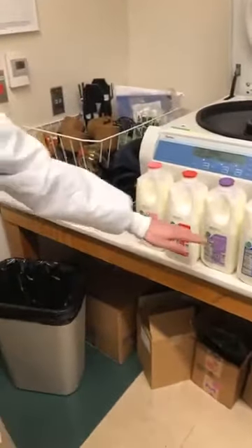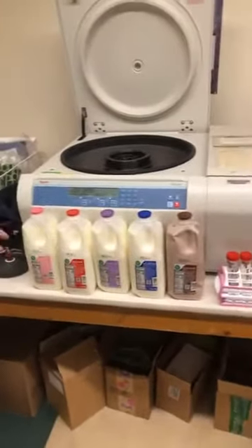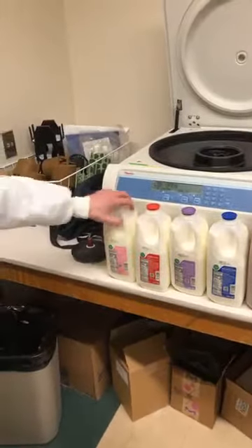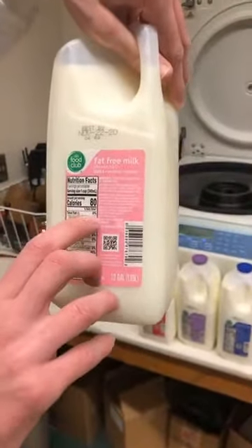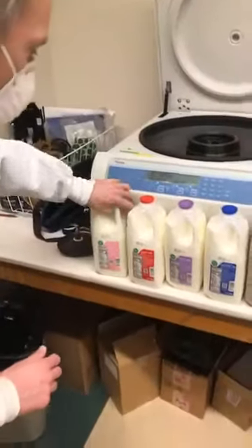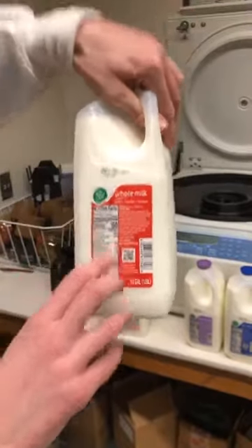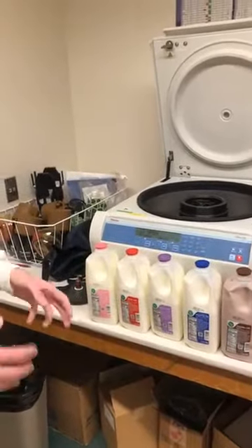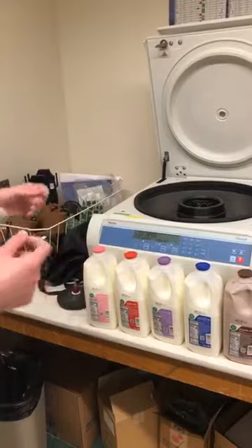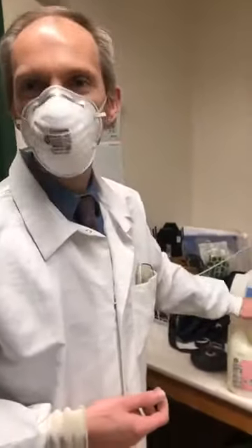The difference seems to be about fat, right? Fat-free, low fat, reduced fat — what does that mean? What do they mean by fat? On fat-free, total fat is 0%, whereas in whole milk, total fat is 10%. What do they mean by 10%, 0%? They're saying how much fat is in the water. So what I want to do is: can I separate out that fat from the water to see how much is actually present?